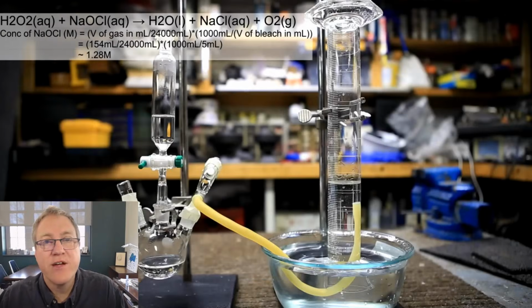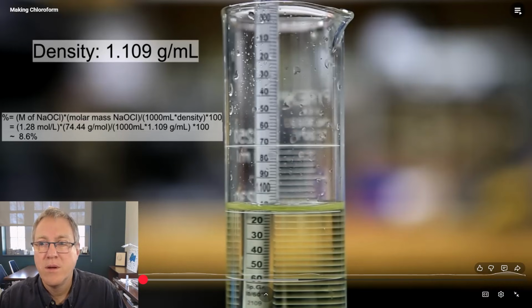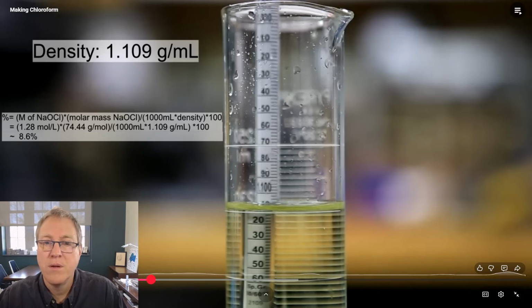Okay, so we're back to this titration. You've done the titration. This isn't necessary, but I used the hydrometer to measure the density of the bleach, and I determined that the concentration was about 8.6%.